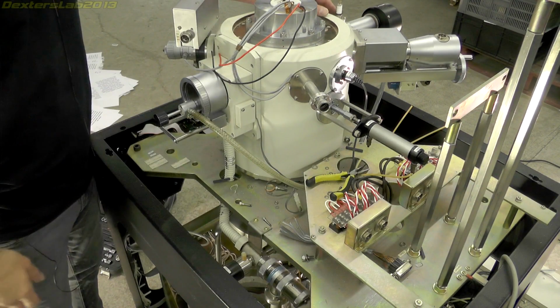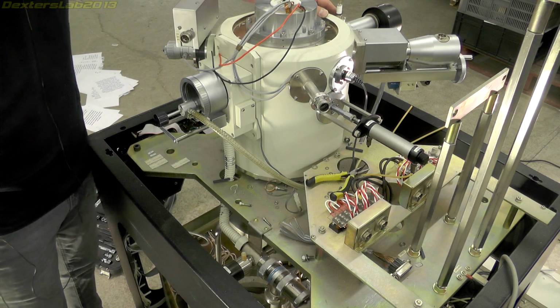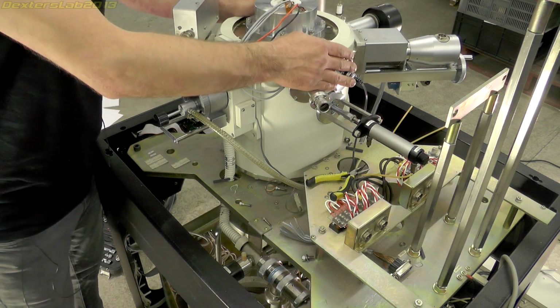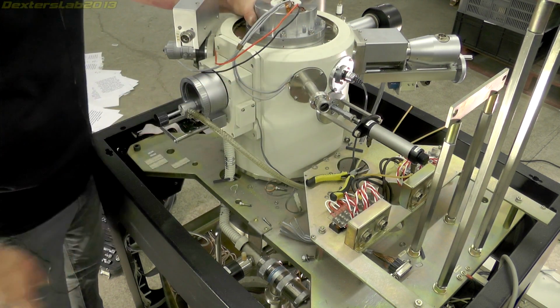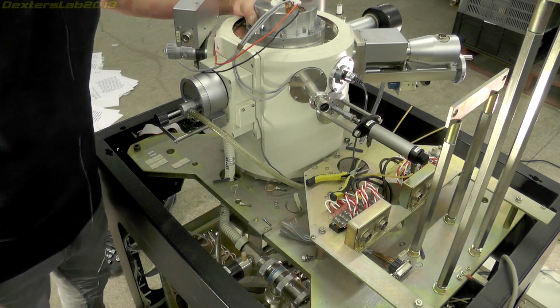Right, that is about all I've got time for in this part. I've just got the main column off, and the next step is to remove more of this and have a look at the column and everything else underneath. There's actually quite a bit, isn't there?